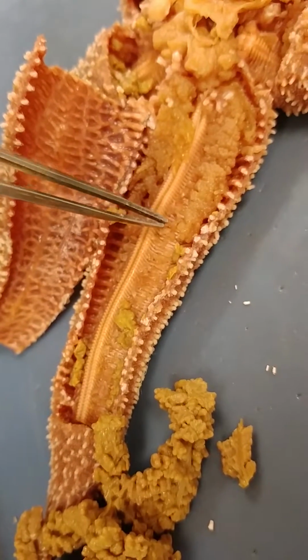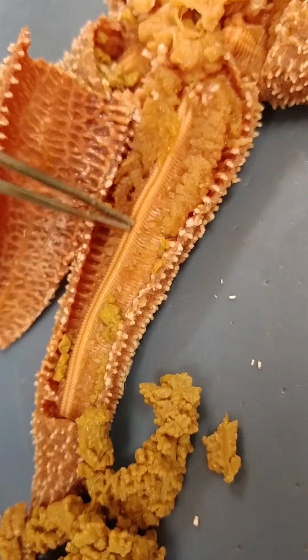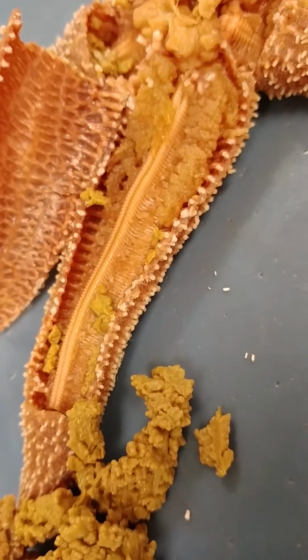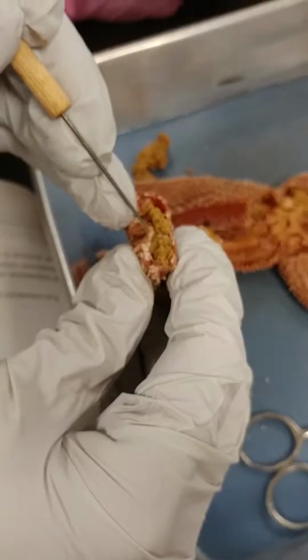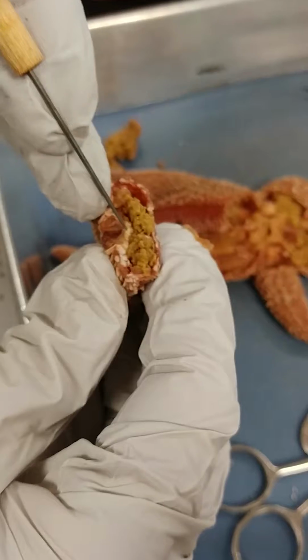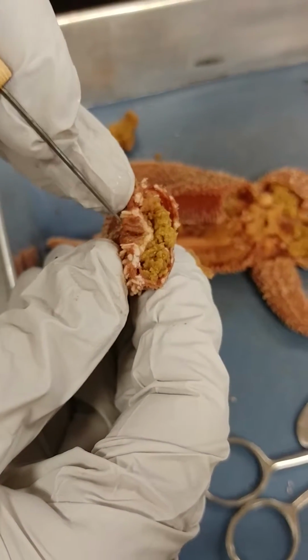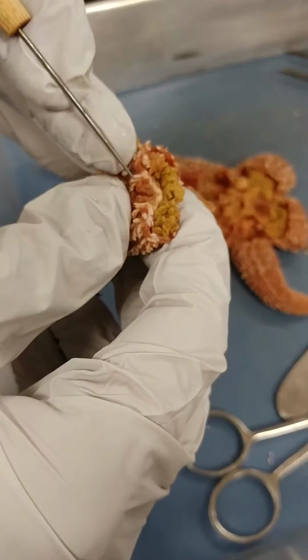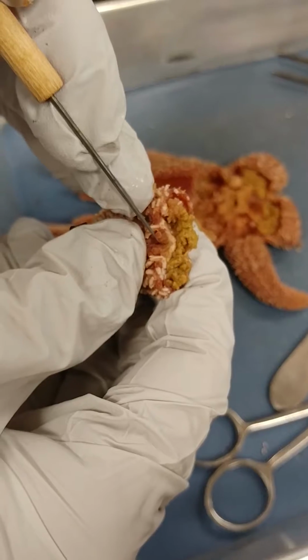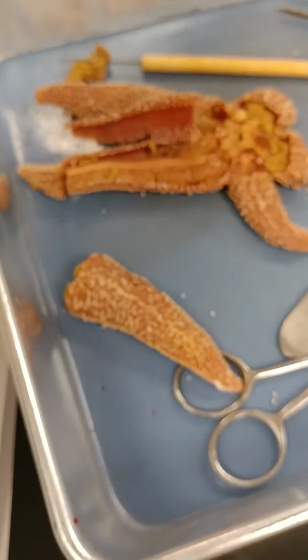Okay. And so those ampullae are connected to a radial canal that's embedded inside this structure. So you're really not going to see it until you do a cross section into the arm. Okay. Little thing right here, just on the bottom of that ridge. Yeah. And then on either side you see tube feet. What is it? The tube feet. Tube feet. And at the end of each one, you see there's a little depression, so that's a little suction cup.